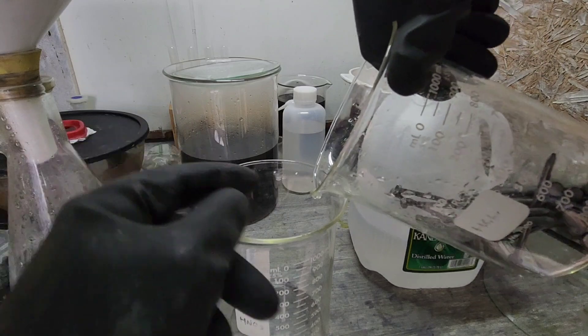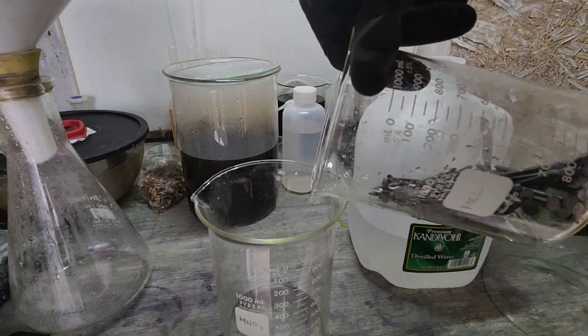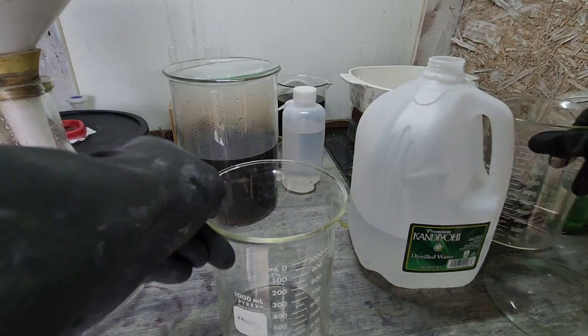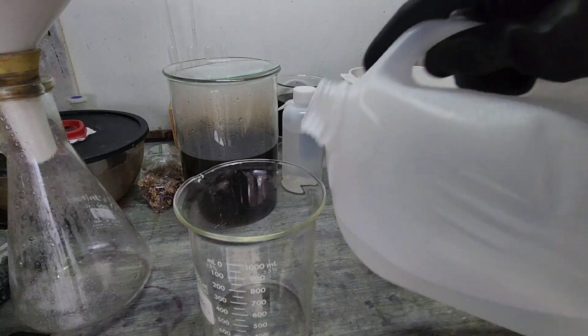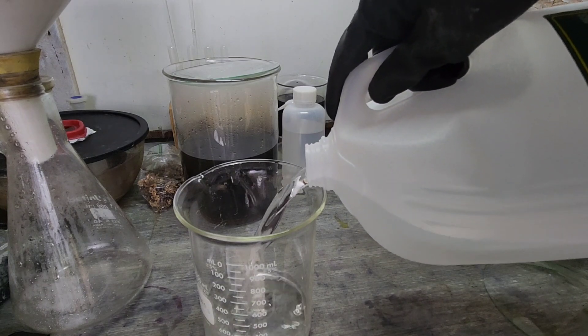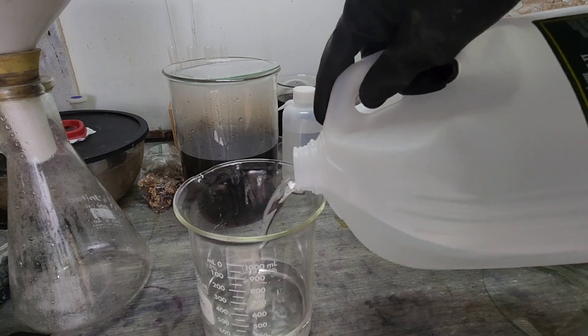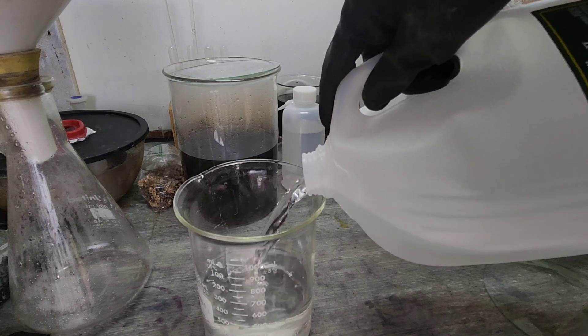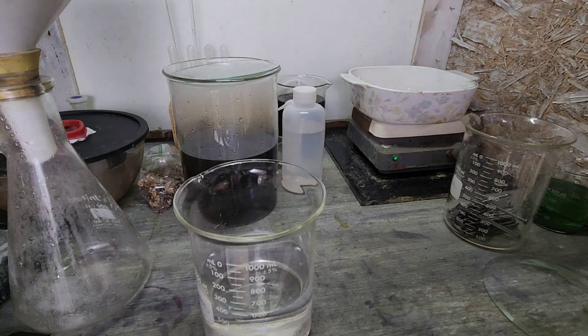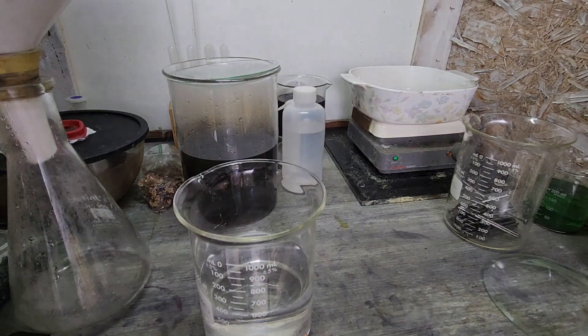We'll do our weighing in another container here. So we're going to go with 600 milliliters of distilled water.